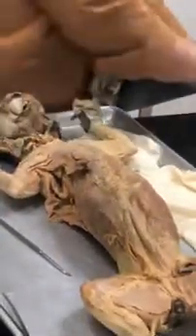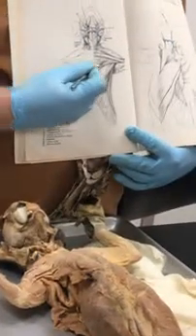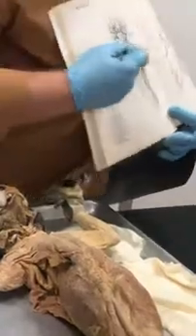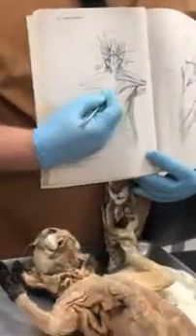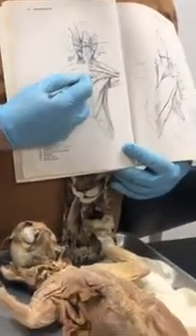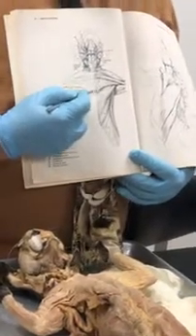So if you look at the picture here, there's one over here that is making a bar. Can you see it? There's one on that side too. It's number, my eyes are going, is it 13? My eyes are bad too. 11. Oh, it's 11. So the 11 over here is called the pectoantebrachialis. Again, that's a muscle that's unique to the cat. But underneath that is going to be the pectoralis major muscle.